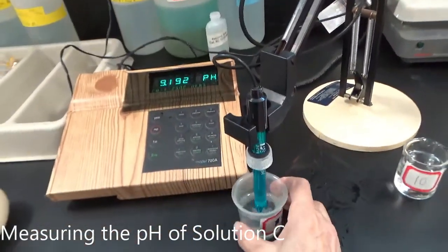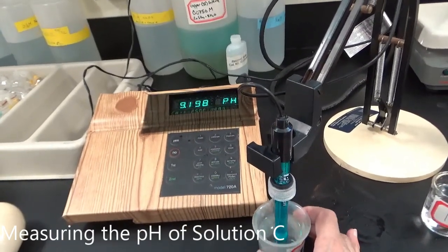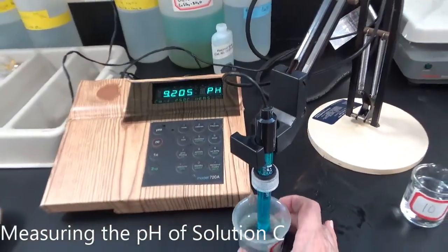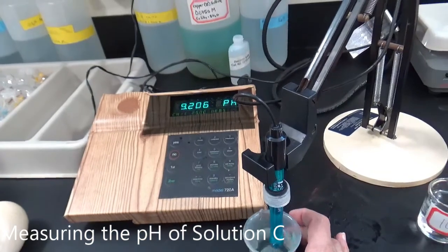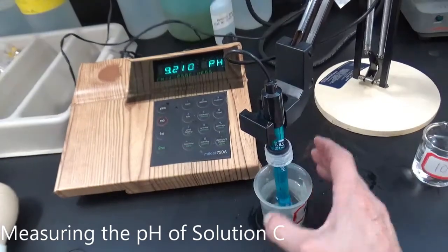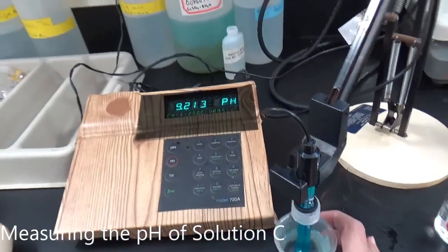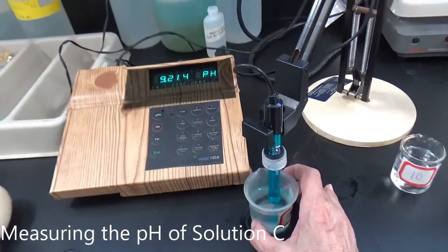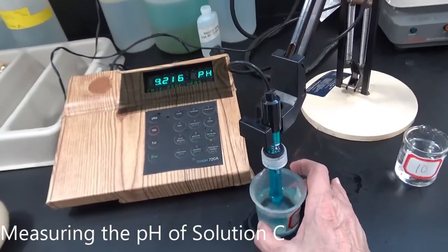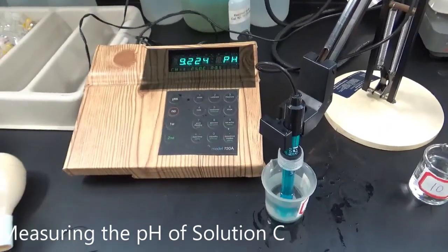Okay, I'm going to again stir this a bit, wait for the reading to stabilize. Push this in a little further. Good. I'm going to wait for the beep. Hope I get a beep. All right, 9.224.